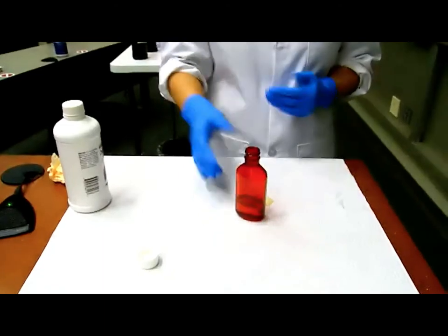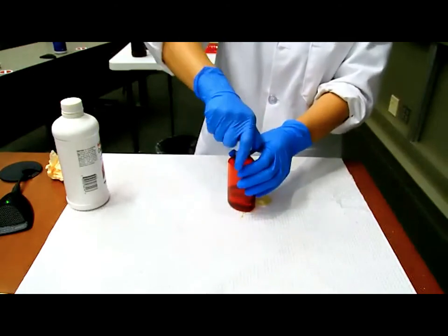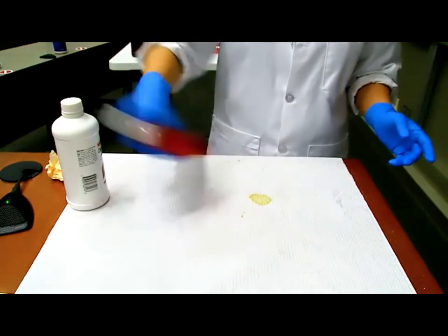Okay, all right, so we are ready to add the cherry syrup, but before we do that, because I have oil and a lot of surfactants in there already, I want to shake really well first, so that all the oil will have a good mixture with the surfactants.